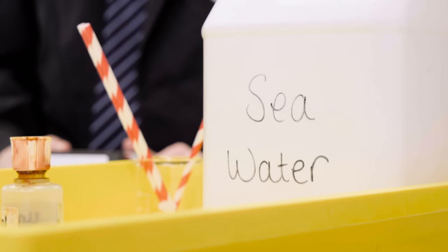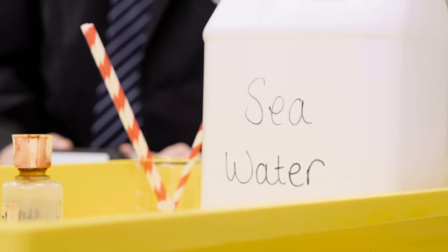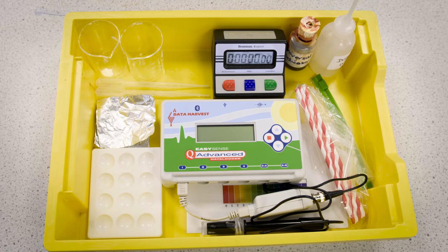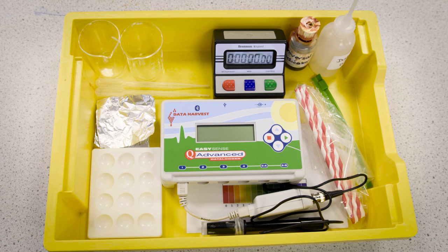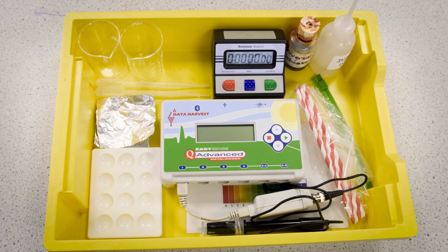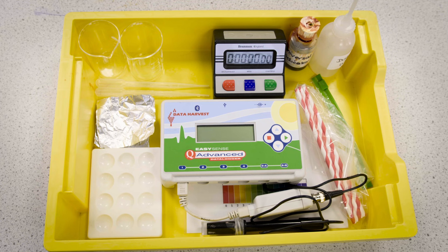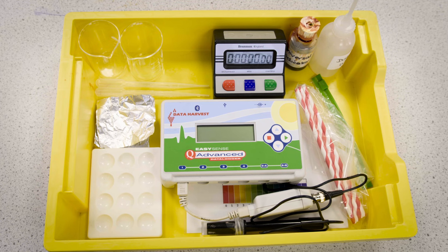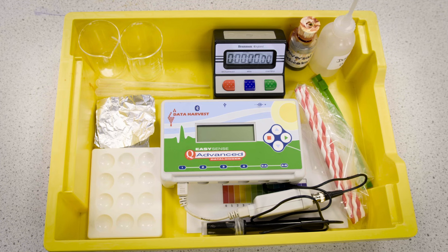For the first experiment, you need salt water. Each group needs two beakers or cups, one lid, two straws, a pH meter or universal indicator, and a stopwatch.